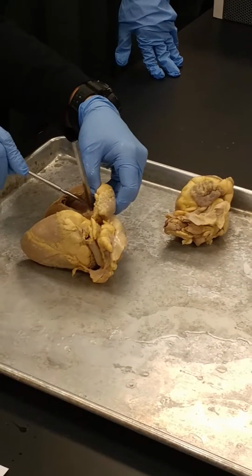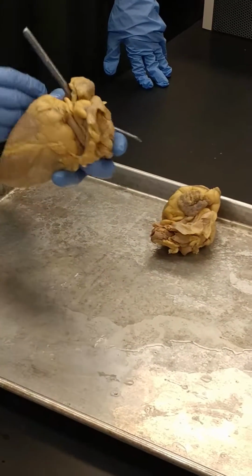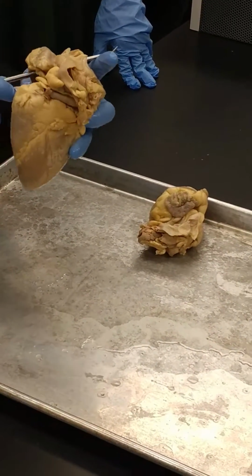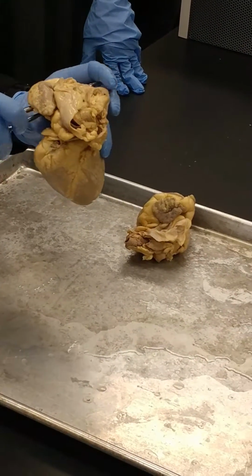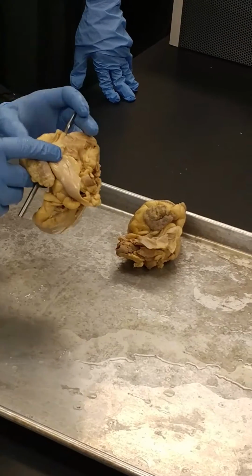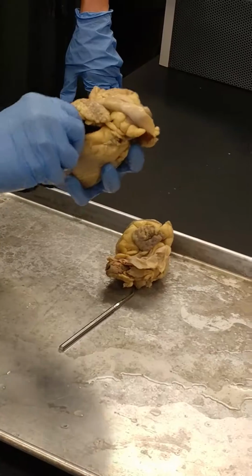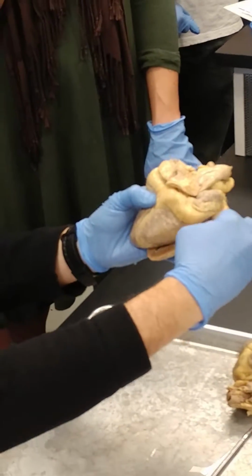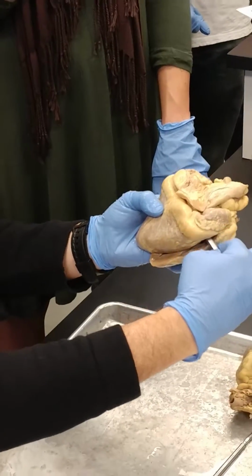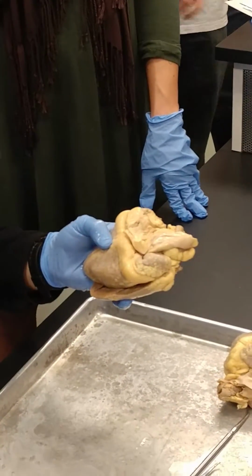So this probe is through the coronary sinus. The other probe I'm going to stick up through here is going to be through the superior vena cava. So that's the superior vena cava right there. And then the coronary sinus is actually just below it, another little hole, but watch where it goes. It's coming along. See the back of, see that right there? See that? Now that's in the hole. See the probe running against that? That's the great cardiac vein that drains into the coronary sinus. Where does it go? It drains into the right atrium.